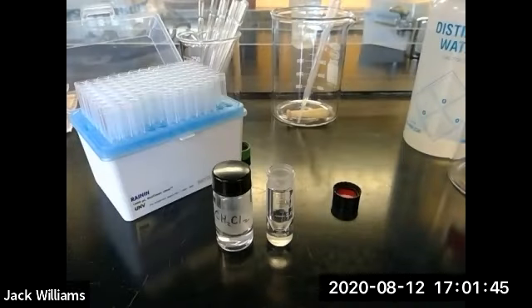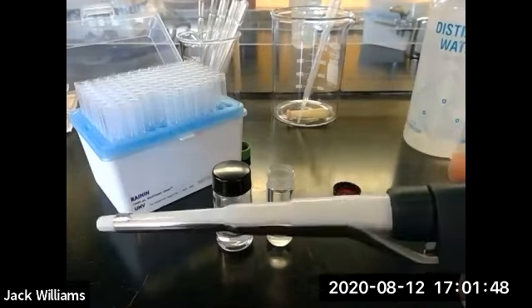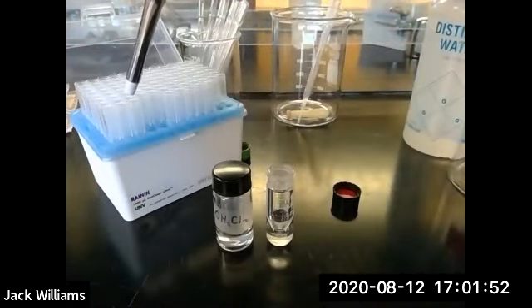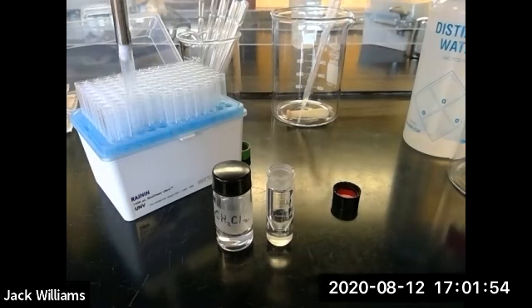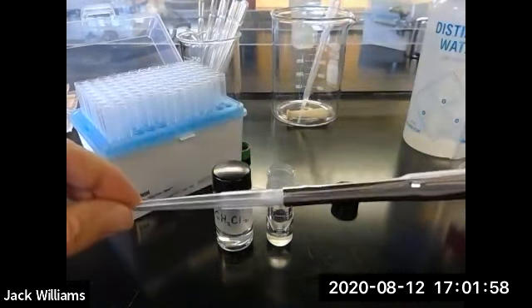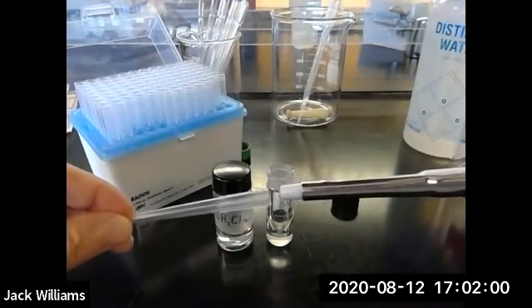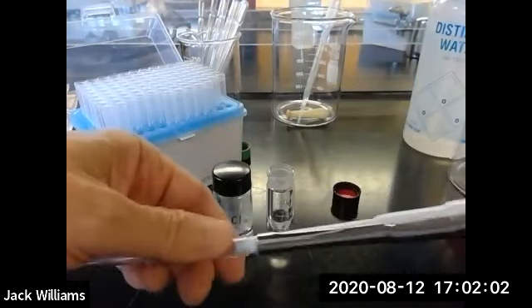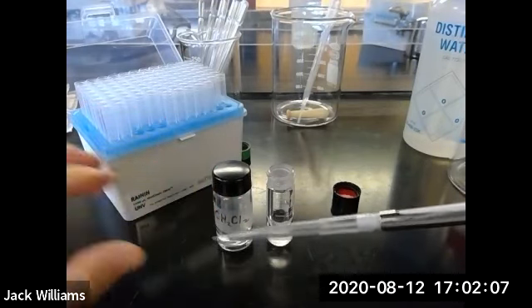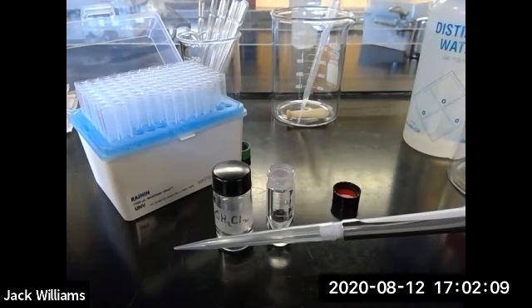Okay, folks, so continuing, we've got our automatic delivery pipette, and we've got some pipette tips in a box. You can just press down on this. I would make sure that this is secure. You can just test it a little bit, see how that wobbles off, right? So that's not secure. So just a little pressure like this. Now there's no wiggling back and forth.